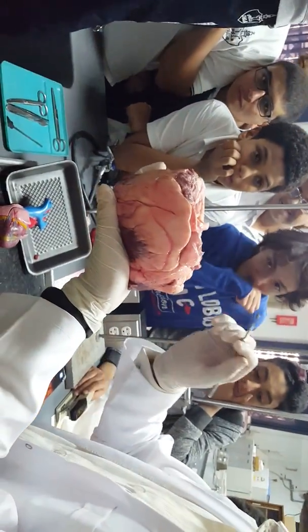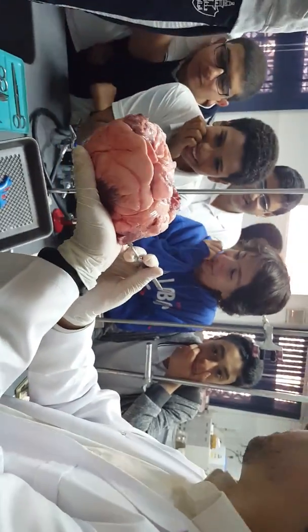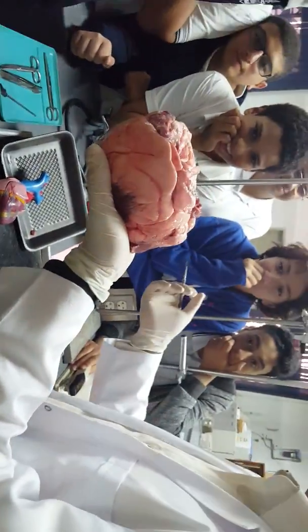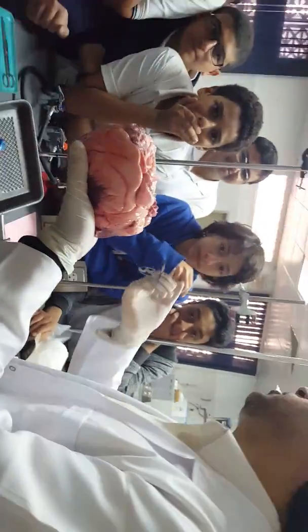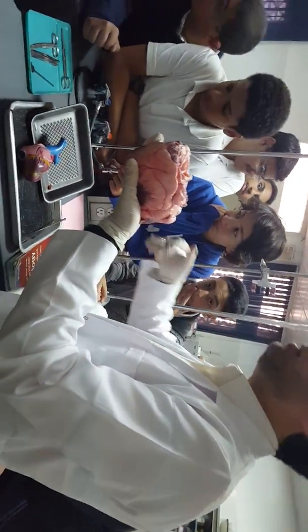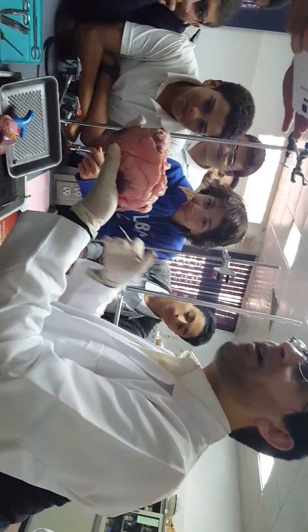This branch is responsible for feeding the muscle of the heart itself, and the muscle of the heart takes the food, nutrients, and oxygen via the coronary artery, and releases them after metabolism and respiration, vital activities.